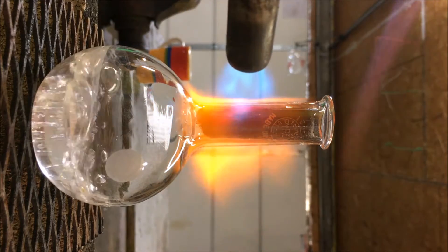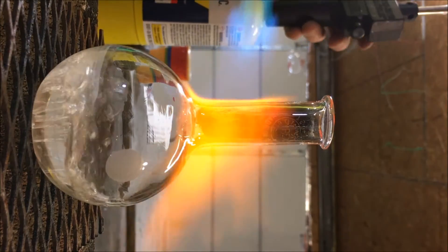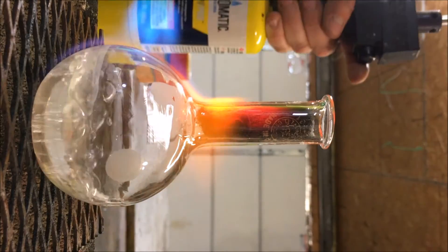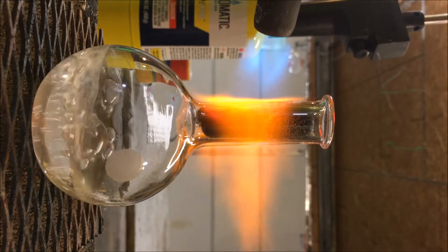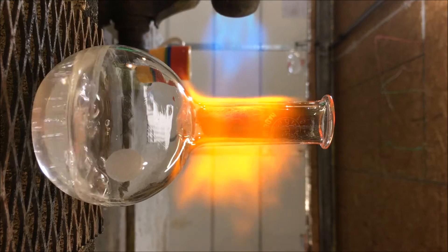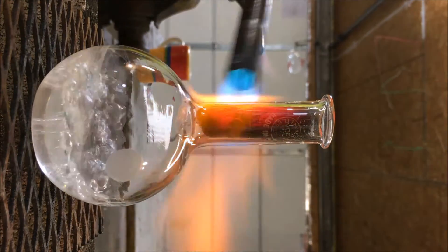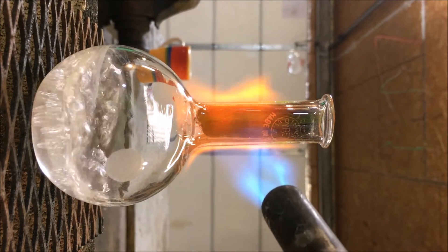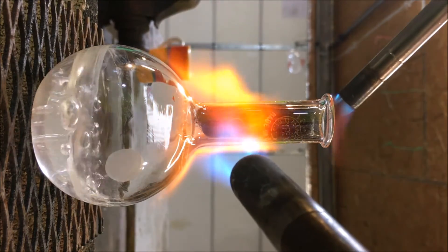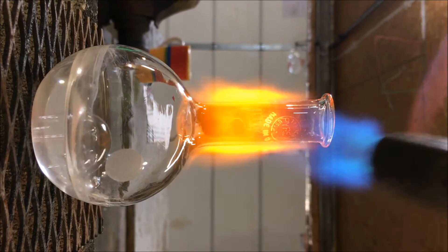No signs of gas. It probably takes a very long amount of time. No signs of gas, probably a little too much steam — it's probably diluting the gas stream too much. It looks like a little bit is happening.